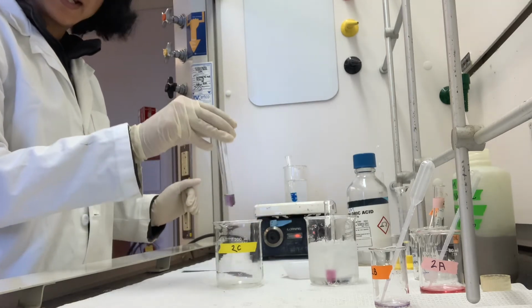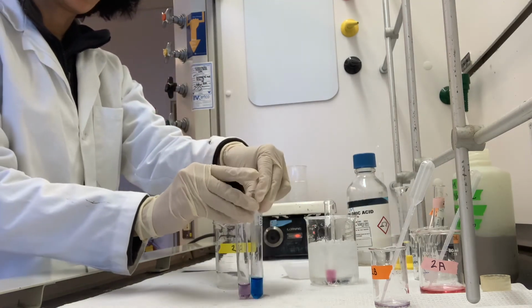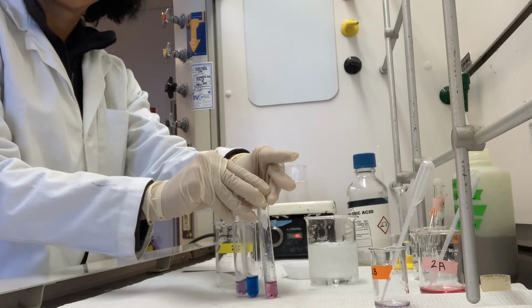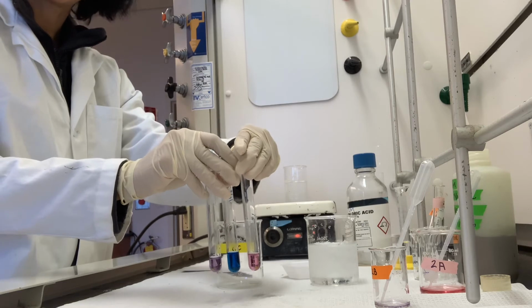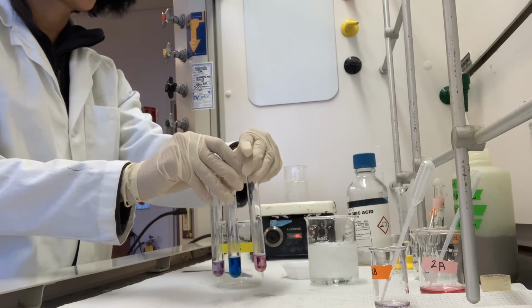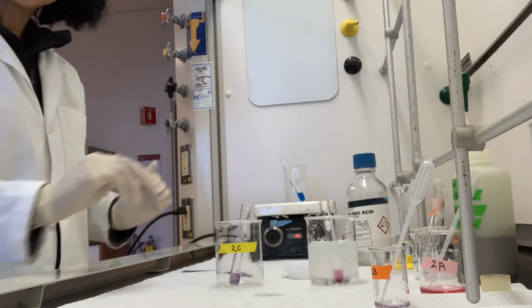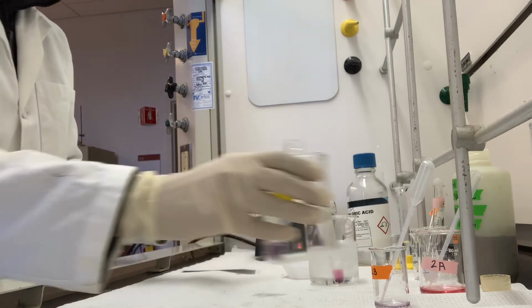So again, I will hold room temperature next to the one that's been in the hot bath, and here's ice. It's a little tricky holding 3 up, but here they are next to each other, and once again we will provide you with some still images of these. Alright, back in the respective conditions. So that was step 2C. We are now ready for step 2D.